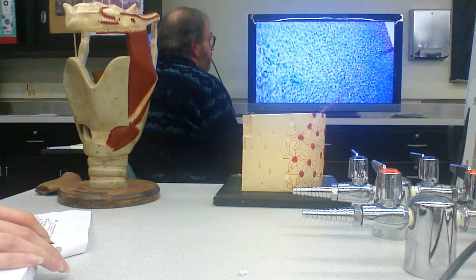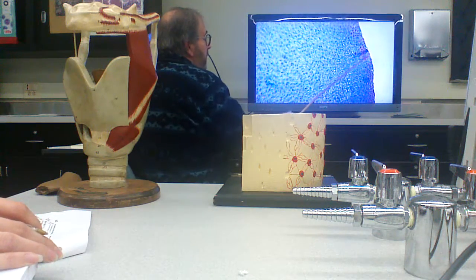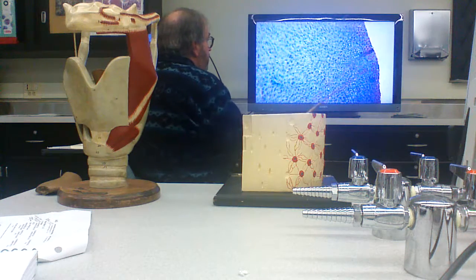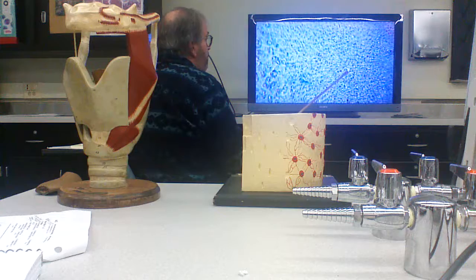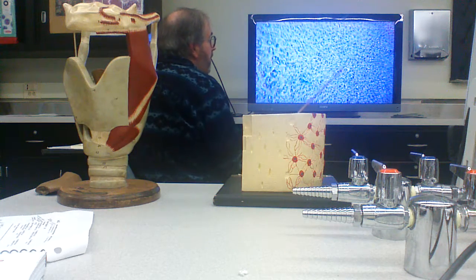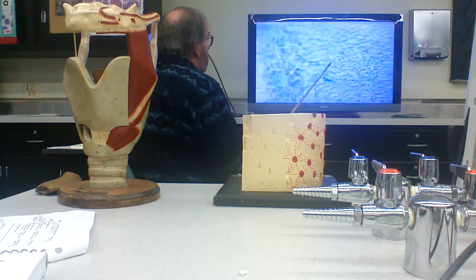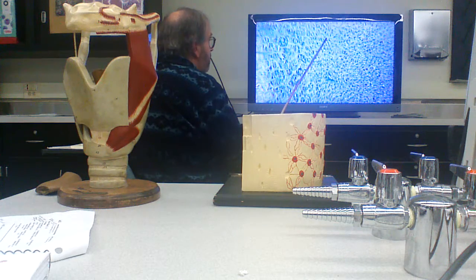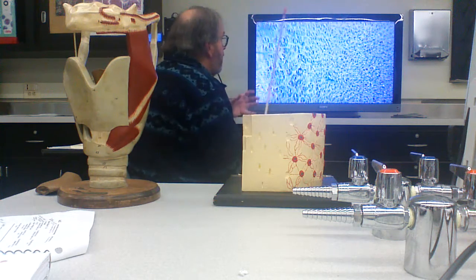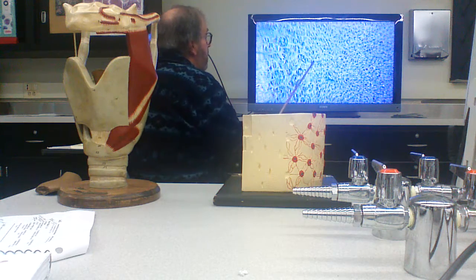The chondrocytes in here can grow by appositional growth out here. And as the cells go through an area of proliferation where they divide, you can start to see 2 cells in the nest and more. Then an area of hypertrophication where cells are growing and getting bigger, and making cartilage.